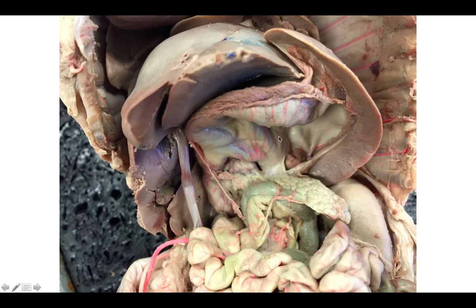Here is a better view of the pancreas. So here's the liver up here. This is the spleen, this long organ right here. Right here is the stomach. And if you lift that stomach up, you have a pretty good view of the pancreas. The pancreas always looks like chewed up bubble gum, so if you see this texture, you know that you've found the pancreas. Here is the umbilical vein as it heads up underneath the liver.